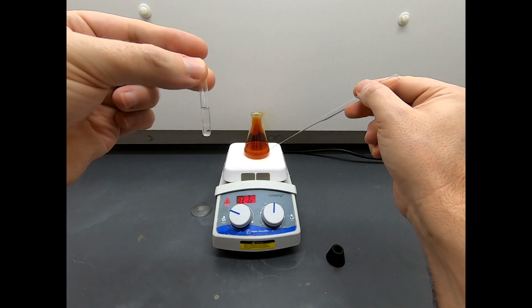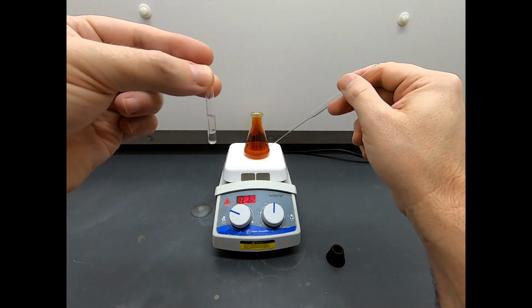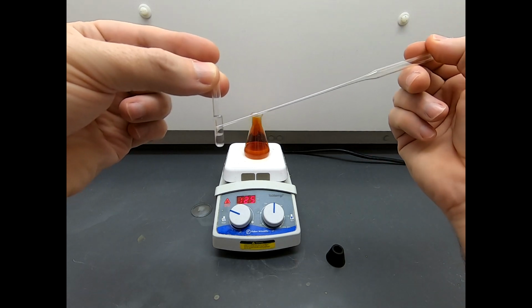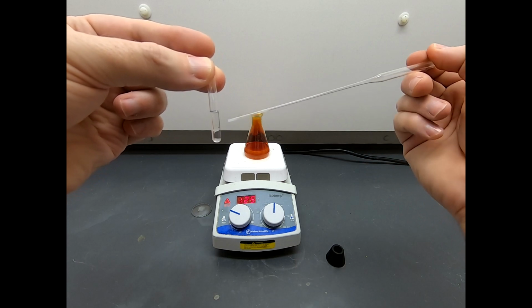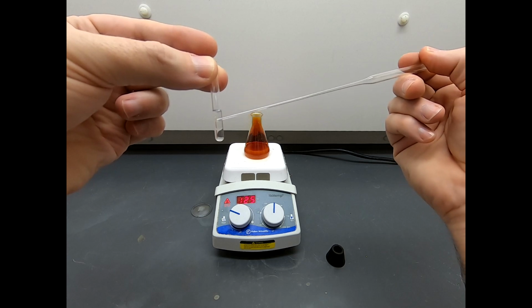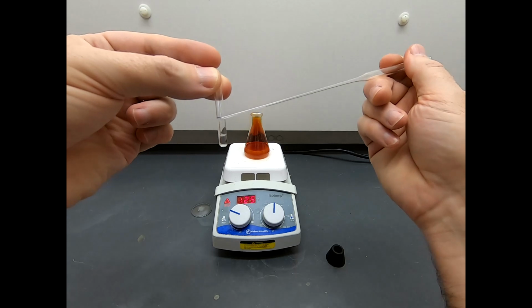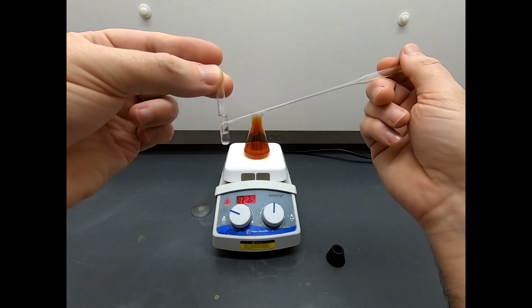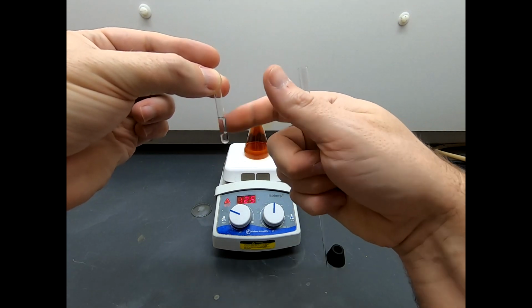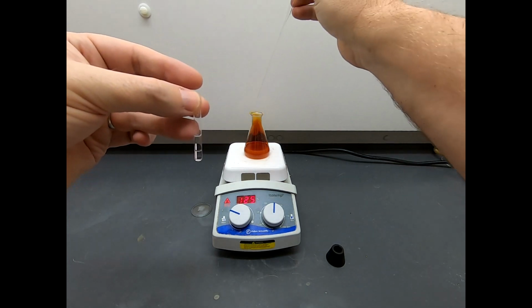Now when I TLC this mixture, I don't want to put all that acid on my TLC plate. So I'll just get a small drop out of this reaction mixture, and I'll put it in this mixture of ethyl acetate and water, and I'll let that mix around. All the acid will go down into the aqueous layer, and that'll leave on the top layer just the organic compounds like unreacted starting material, hopefully the product, and maybe some impurities. So this little mini liquid extraction, which I'm calling a mini workup, is how you can separate some of the aqueous materials from the more organic materials.